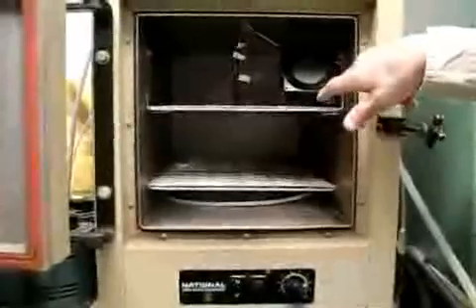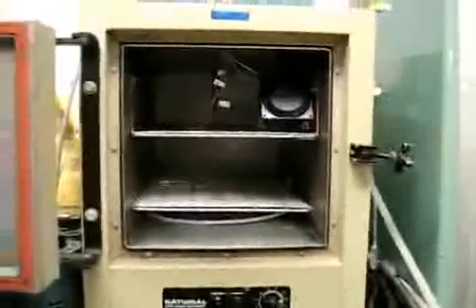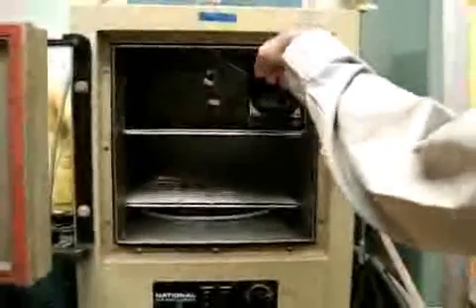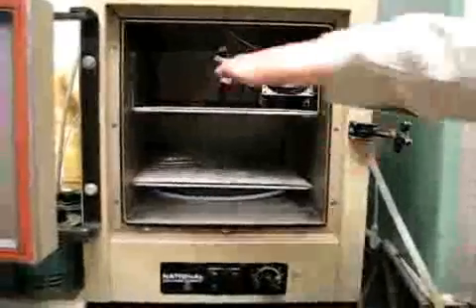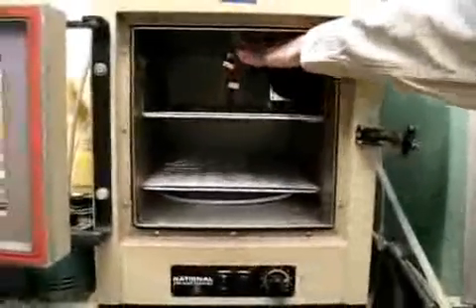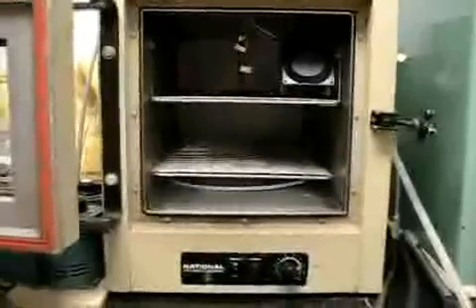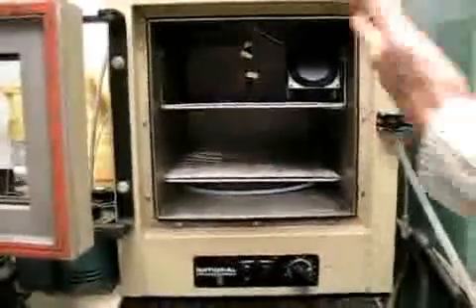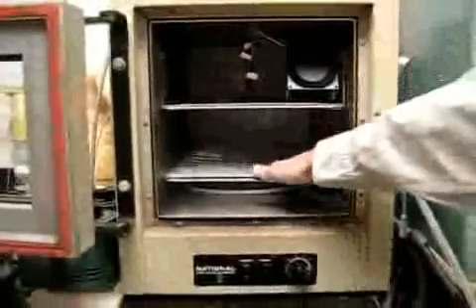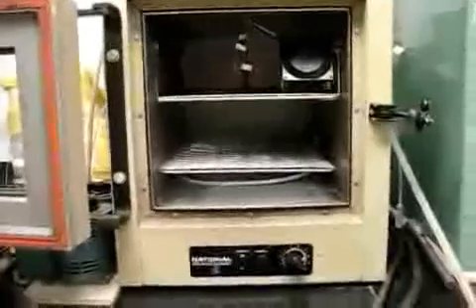To stir the air within the unit, we have an electric fan blowing air at a slight angle down from the front of the furnace here at a rate of about 12 to 13 feet per second. We will be arranging the bottles so there are no bottles directly being blown on, for fear of blowing the compound out of the jar, and we don't want something directly in the wind field while the rest of them aren't. So for consistency, we'll have a gap here where it's primarily blowing and a gap right behind it also. And the jars are going to be opened? And all the jars will be opened.